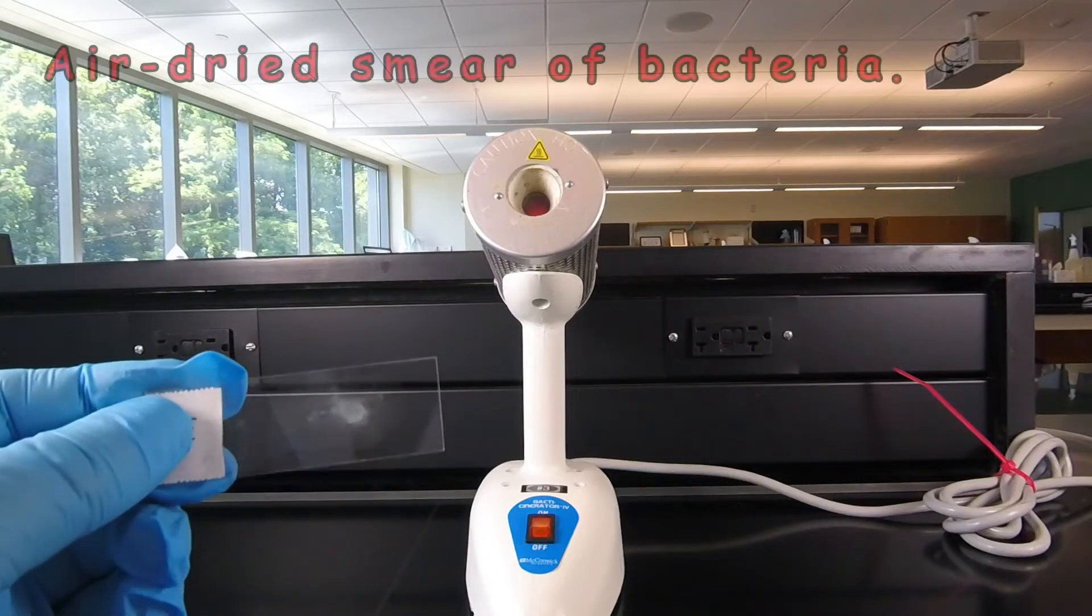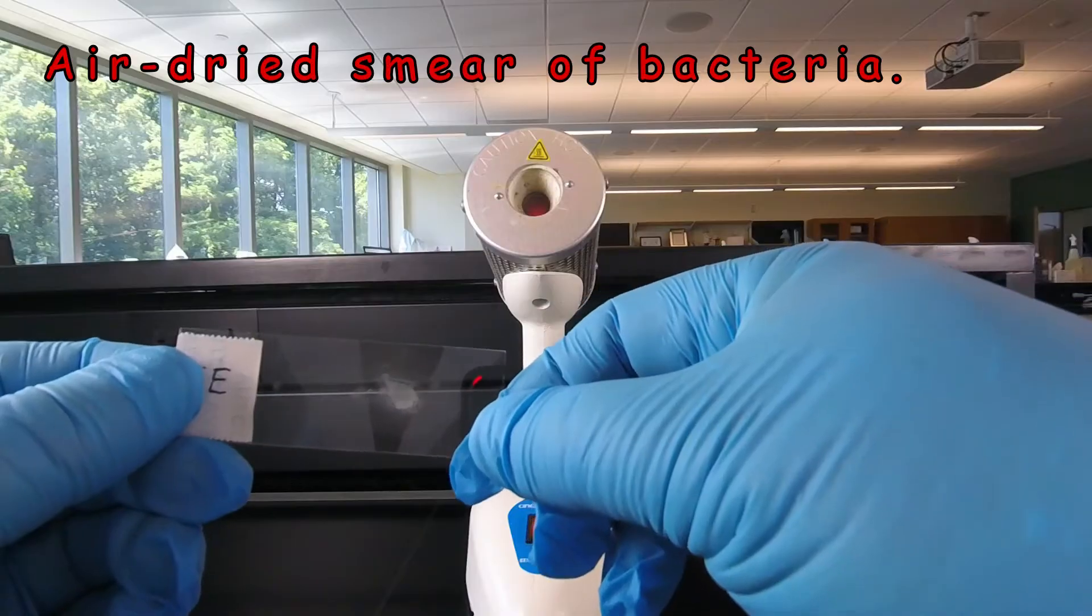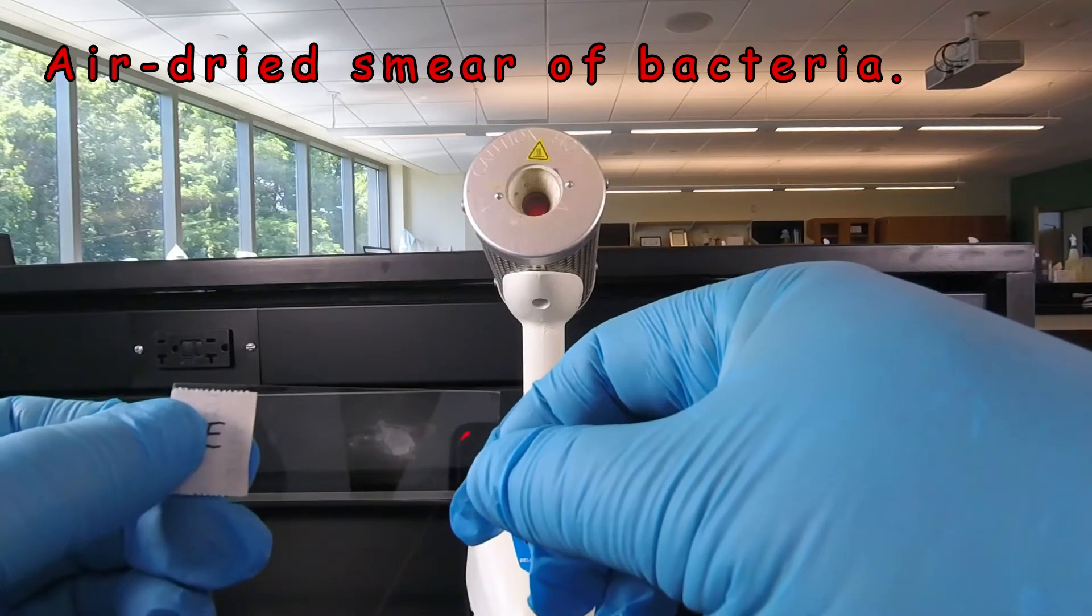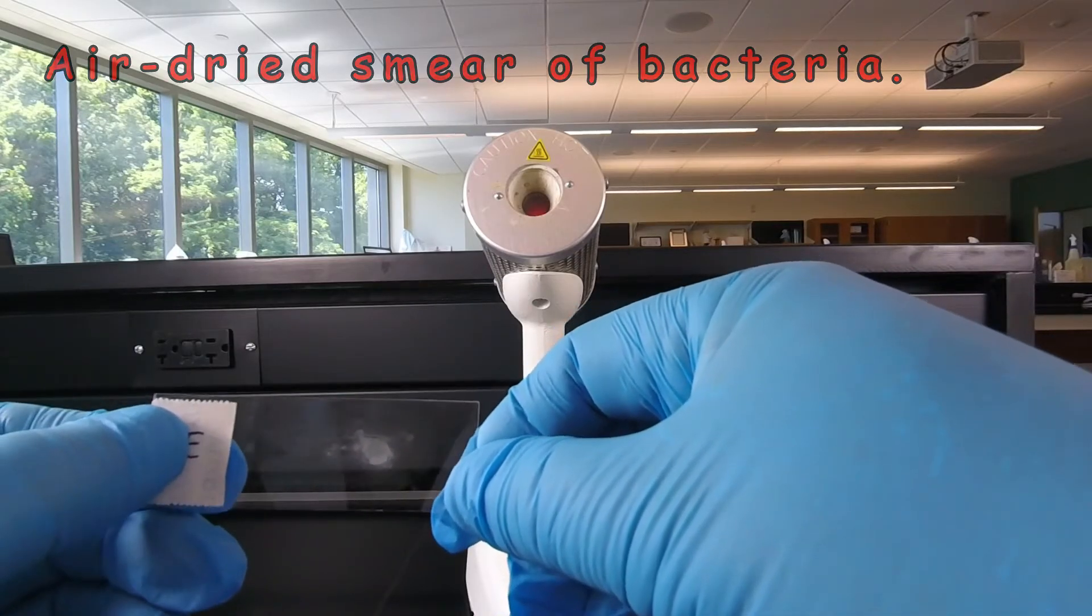So we have our slide air-dried. If we take a look at it, we can see a nice thin film on it that looks a little bit powdery. That's where the bacteria have dried on the slide.